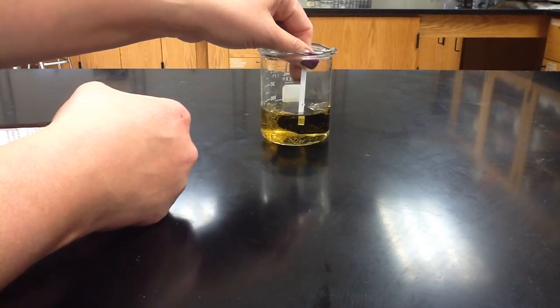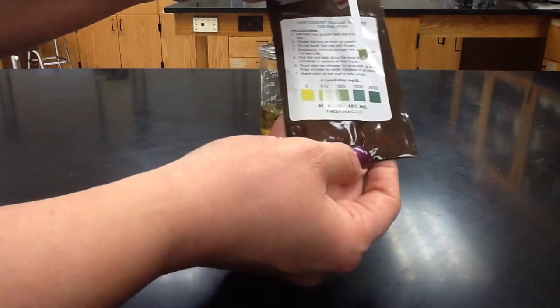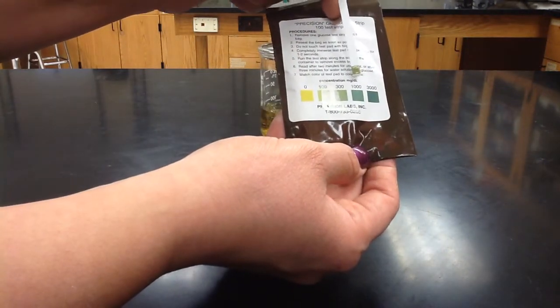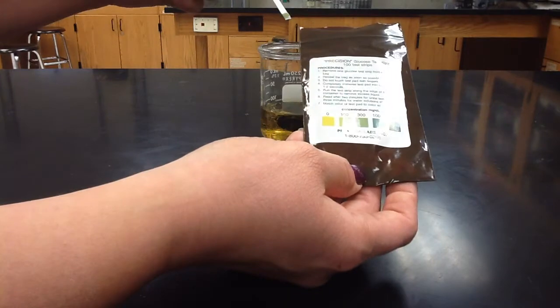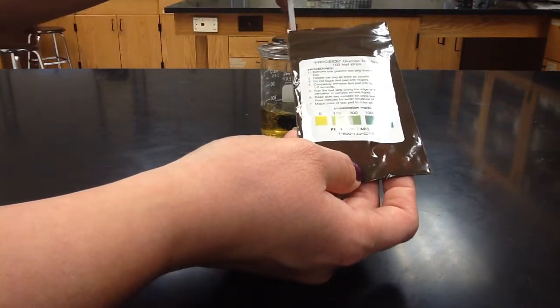So I'm going to dip this in, and it is green. So that means glucose has left the bag.